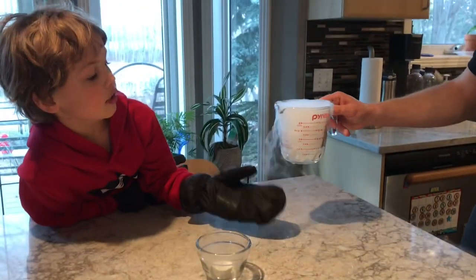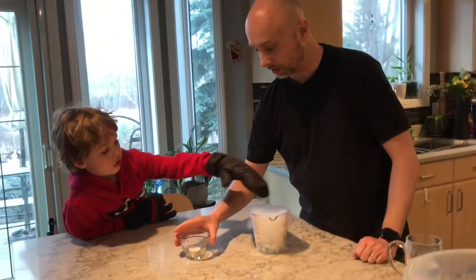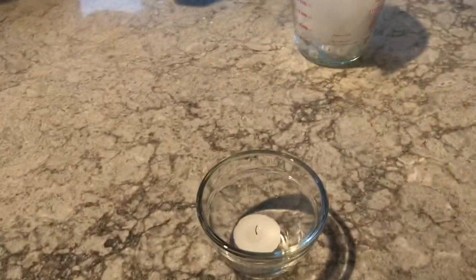Can I go touch the ice now? Again, no liquid went in there. It was just the carbon dioxide gas. So let's try that one more time. Do you want to try it this time, Professor Marcus?